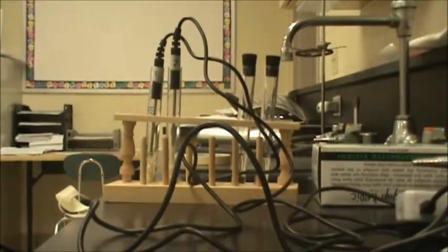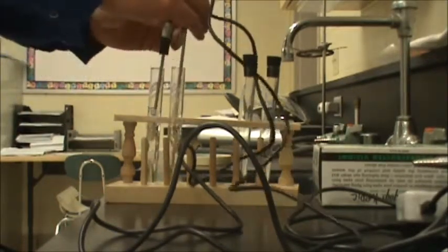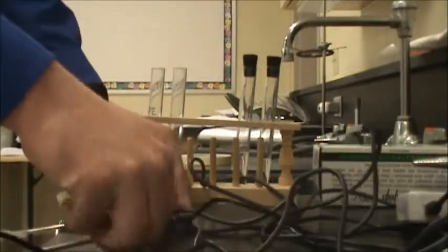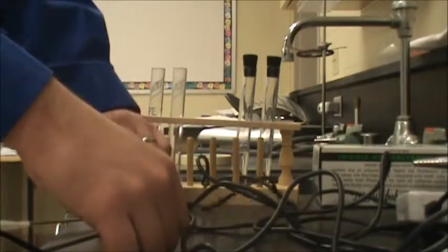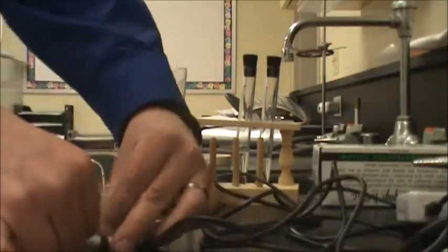You see the 2 temperature probes sitting there. And here it goes, I take both of them. Yep, the rubber bands both broke. That's no big deal, as long as the paper both sits there. We're going to let them sit. Try to tape them down as securely as possible so they're not moving all over the place. Just like so. And now, we wait.